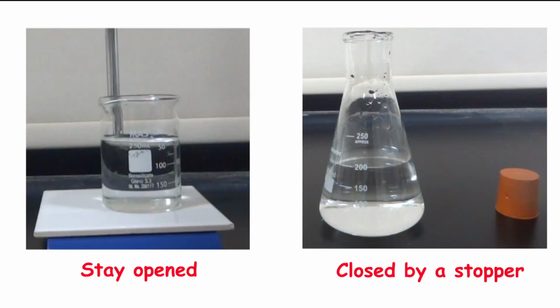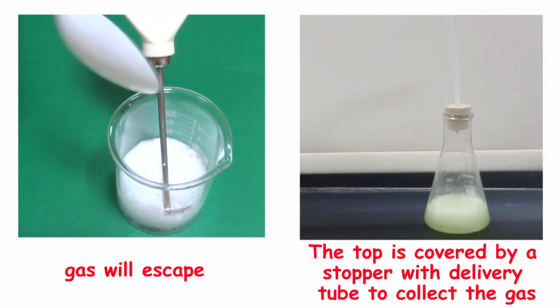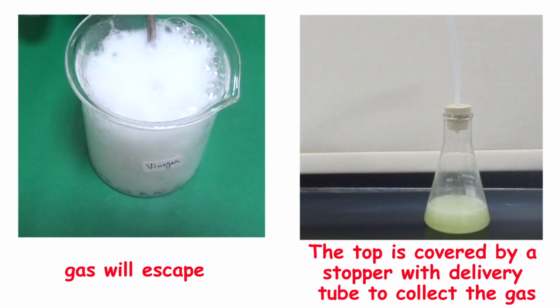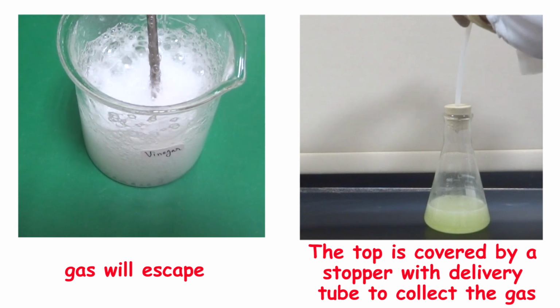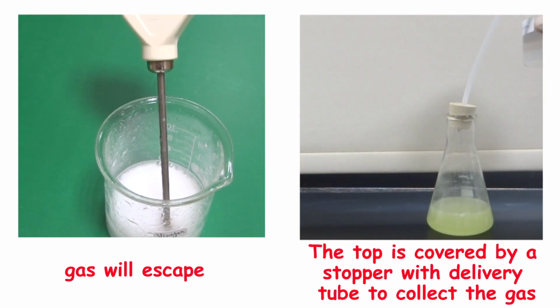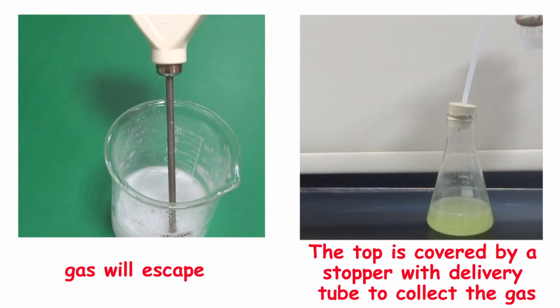The beaker will stay open, while the conical flask can be closed by using a stopper. The gas from a chemical reaction will escape when it's done in a beaker, while in a conical flask, the top is closed by a stopper with a delivery tube, so the gas is recuperated.